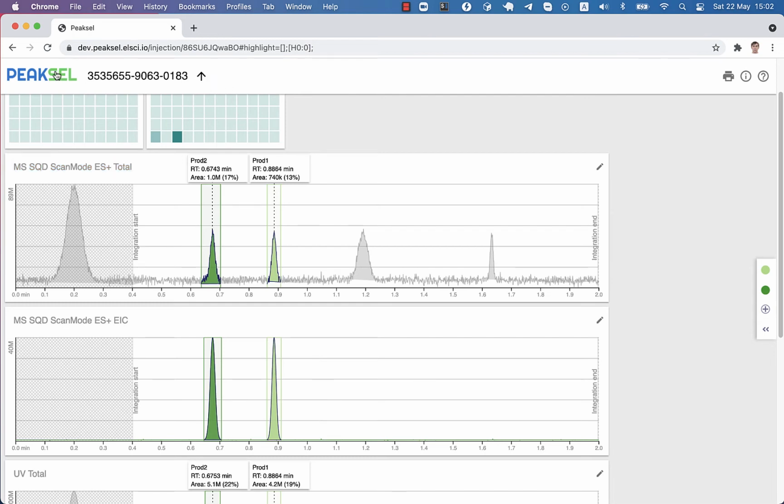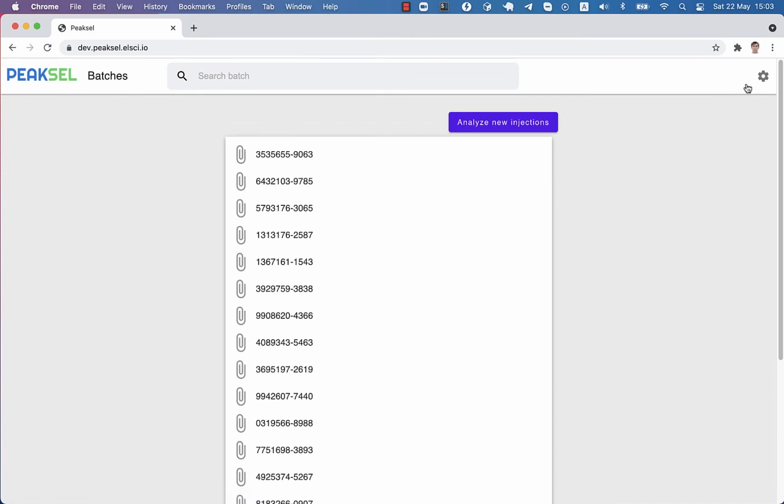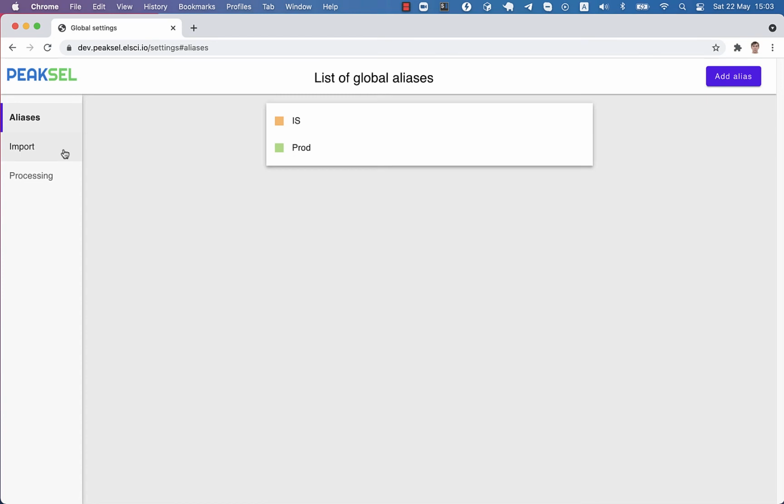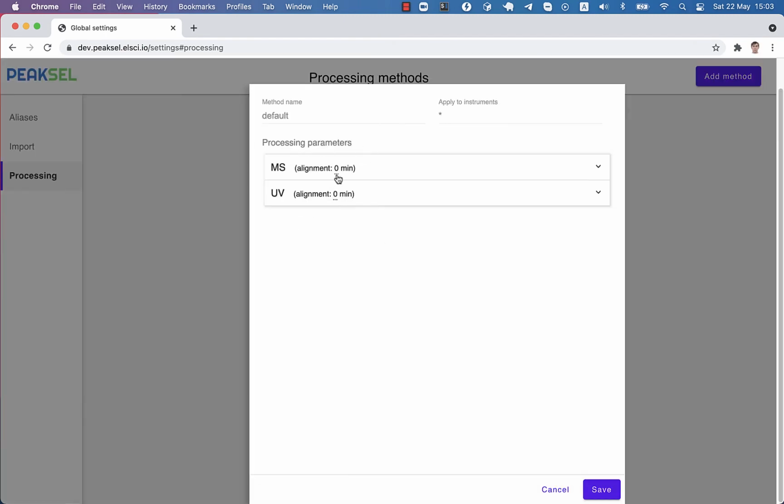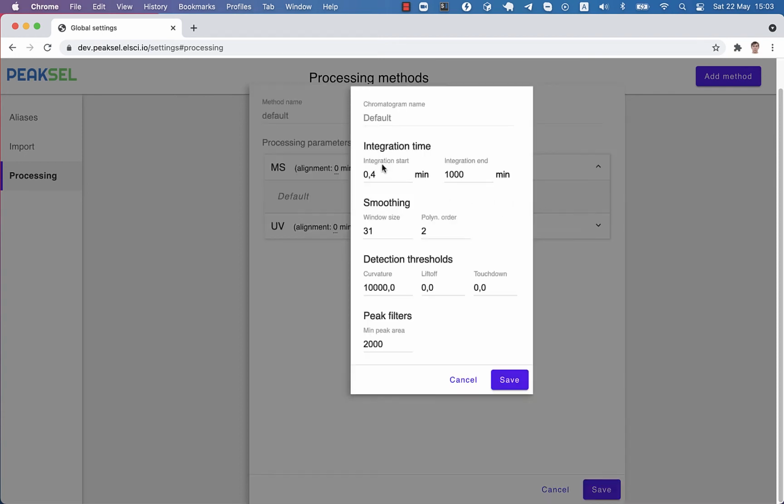For that, we have global settings, which is available from the main page. So you go to the settings and select processing. If this is a new clean Peaksel installation, you will see only one predefined method, the default. You can edit your default, change the parameters, save it, and it's going to be applied to all new injections automatically.